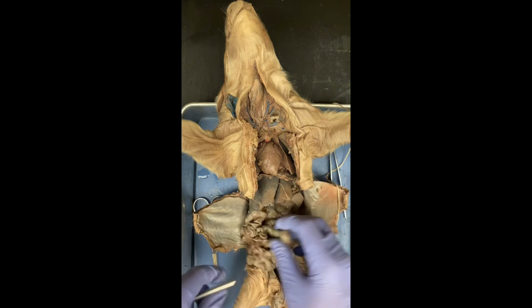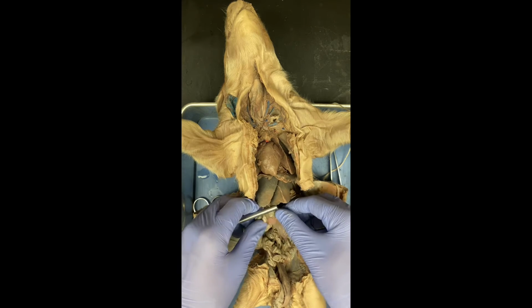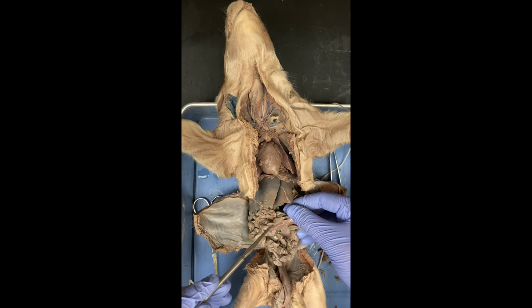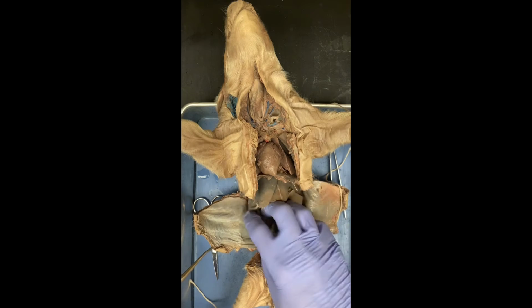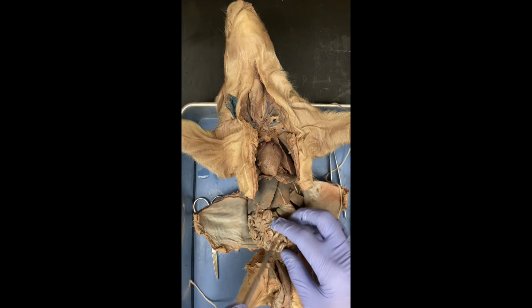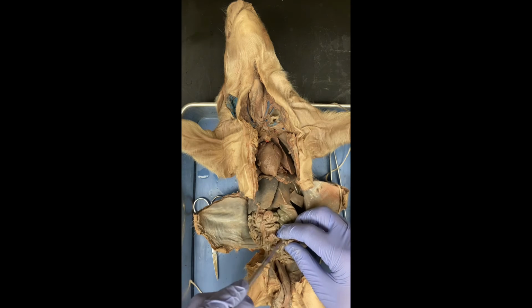The mesentery connects all of the small intestine together. So when I splay it, you can see all these little red veins, red capillaries and such. That's the mesentery, and it holds the small intestine together. So you can see it's not loose, it's pretty compact in there, all in one. And it provides blood flow to the small intestine, so that the nutrients can go into the bloodstream.